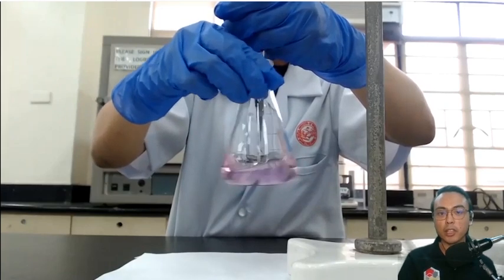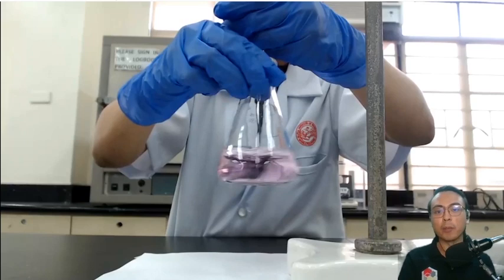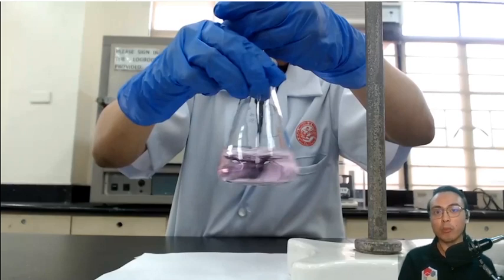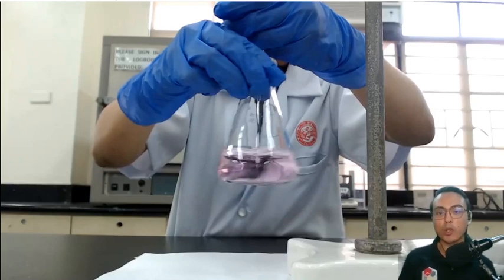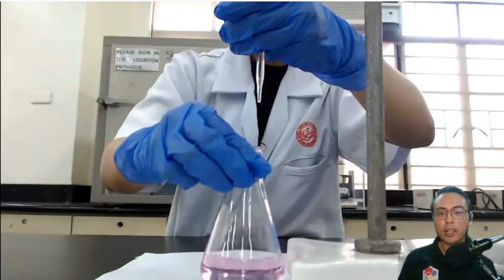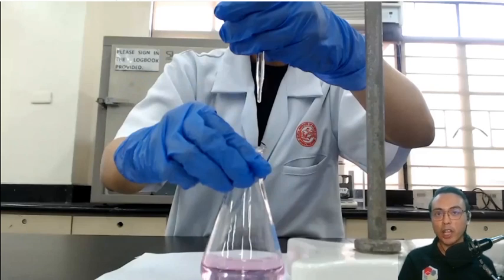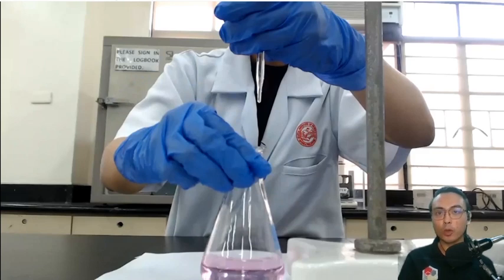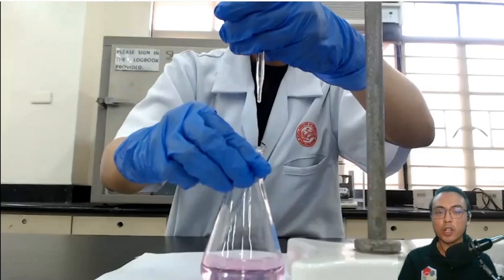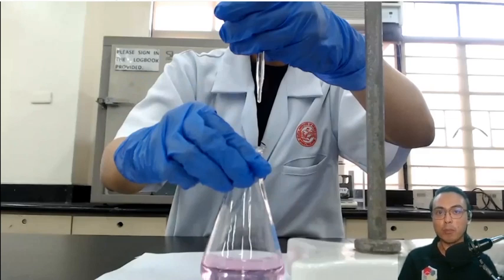This is the endpoint of the titration. The solution is now a very light pink color and it is persisting — it is no longer disappearing. This tells us that the phenolphthalein is reacting with a slight excess of sodium hydroxide in the flask, meaning the contents are now slightly basic. The light pink color persists, and that is the end of the titration. At this point you read the final volume of the titrant from your burette to determine the total volume of sodium hydroxide used, which will be used in your computations. That's the end of the demonstration — visit the raw data provided, prepare your data sheet and final report for submission. Thank you.